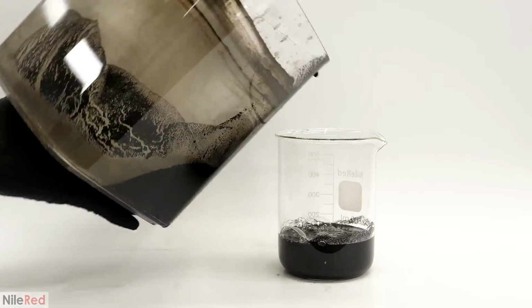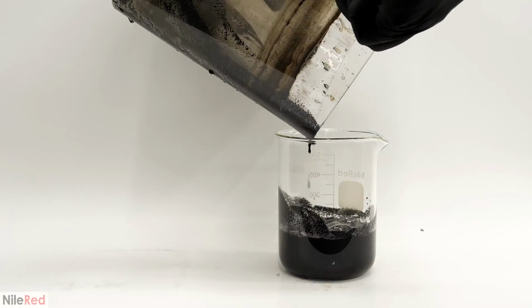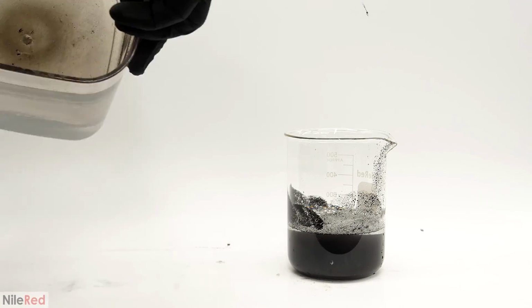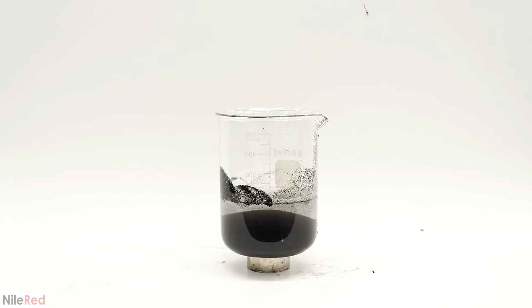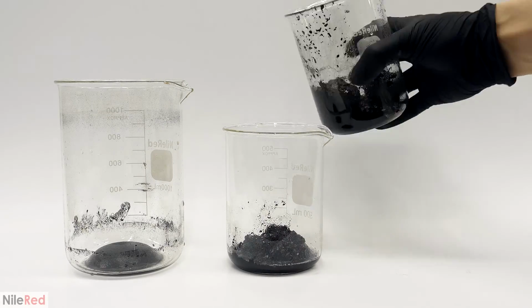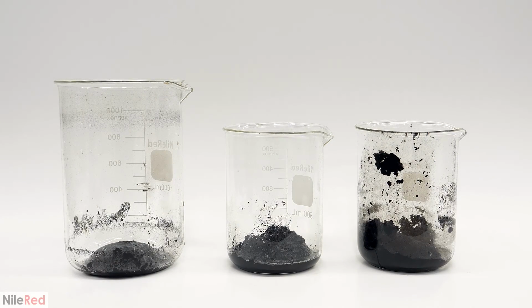Into this one, I poured in what looked like the same amount, did the same thing with the magnet, and then got a third beaker. To this last one, I added the rest, and I also washed the container with a bit of water to make sure that it got out as much as possible. When I put the magnet to it, it separated out like before, but there was a lot more here than the other ones. So once I was done and I had them all lined up like this, I tried to even it out.